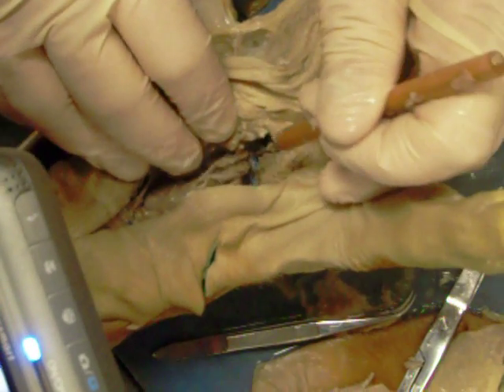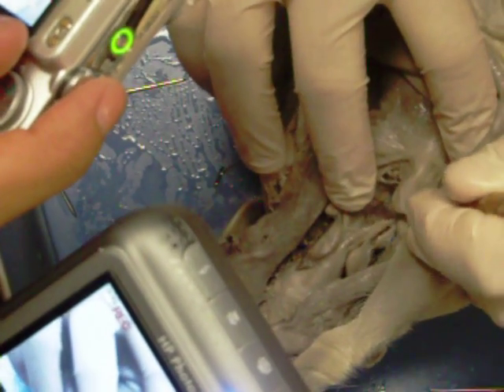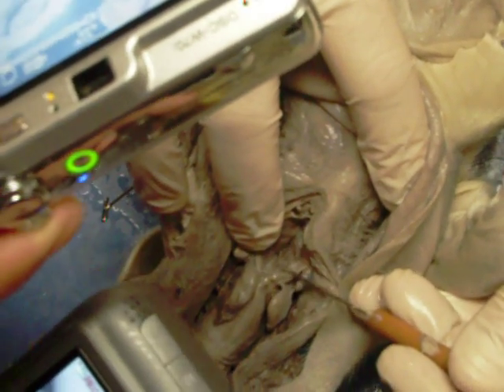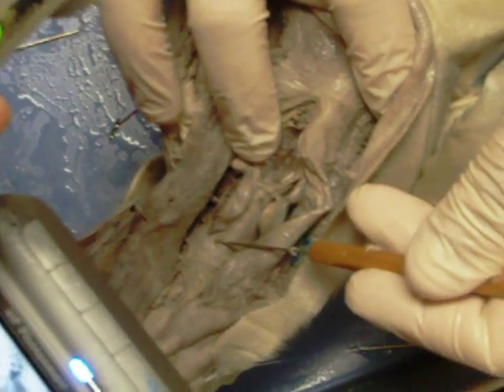Looking more posteriorly, we quickly switch to the other pig hoping the thyroid is better exposed over here. There's the thyroid right here — it's about the size, shape, and color of a kidney bean. This one is not well exposed but it's a little bit better than the other pig. This is the larynx right here — that's the voice box, part of the trachea.